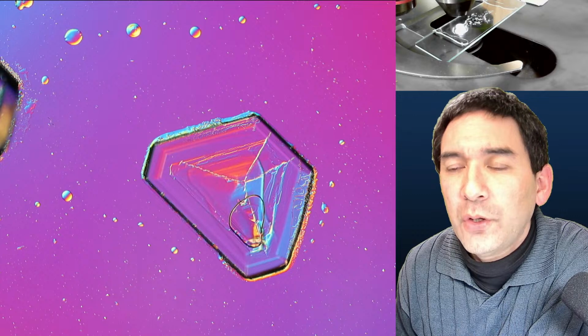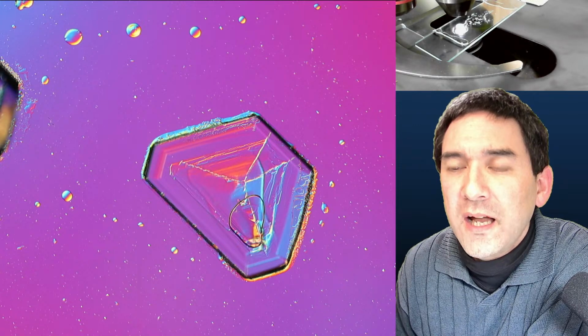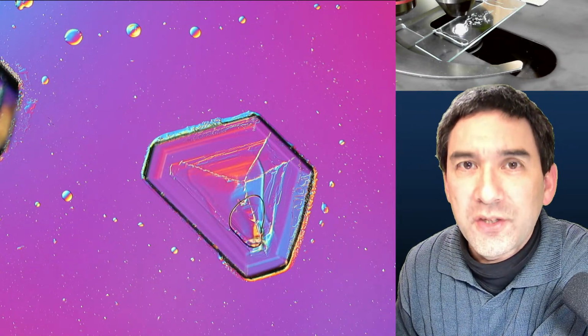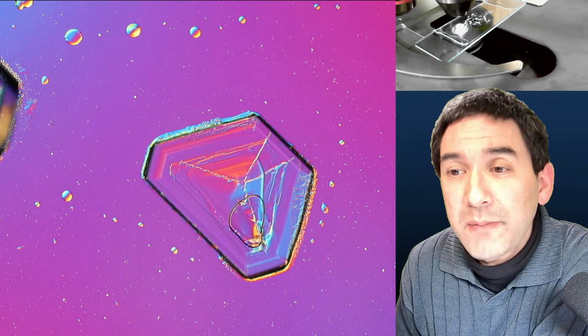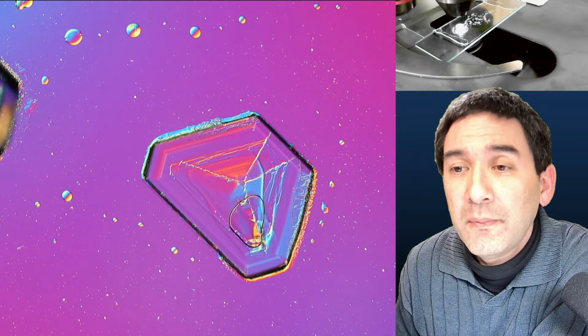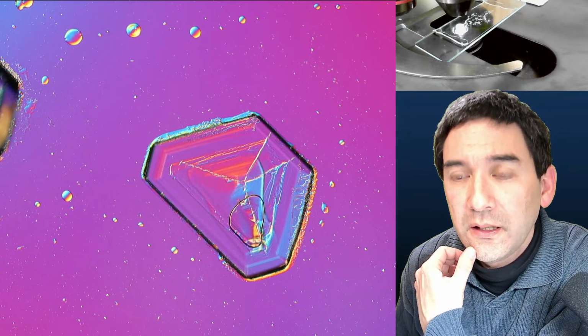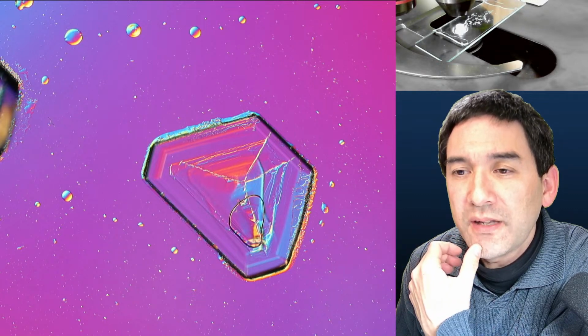Wondering why they have not invented cover glasses with built-in round walls for this purpose. Surely you can 3D print. Yes, I think what you mean is with those round walls, some kind of spacers. As a matter of fact, yes, I already 3D printed some spacers. There are also microscope slides available that are concave. So indeed, they are well slides, or you can have spacers.